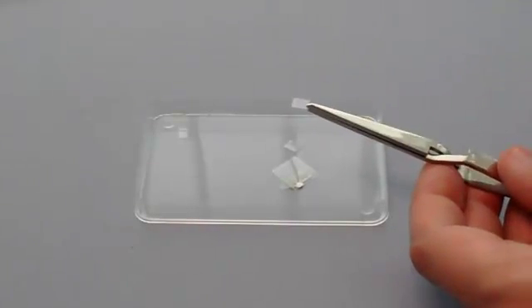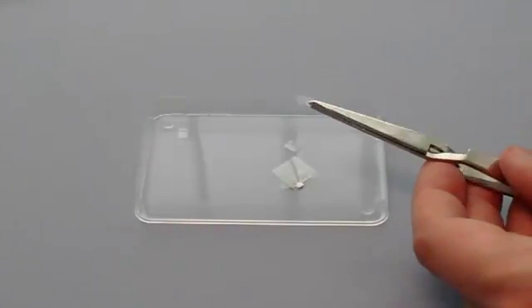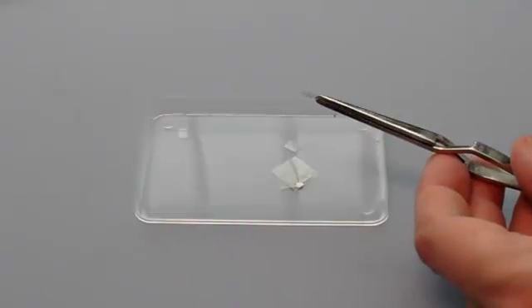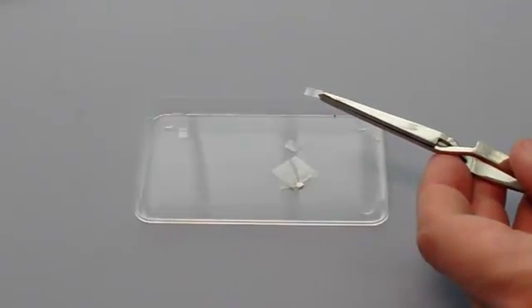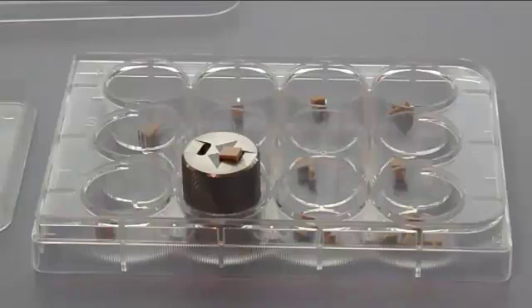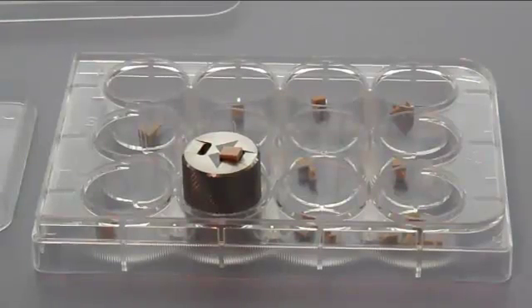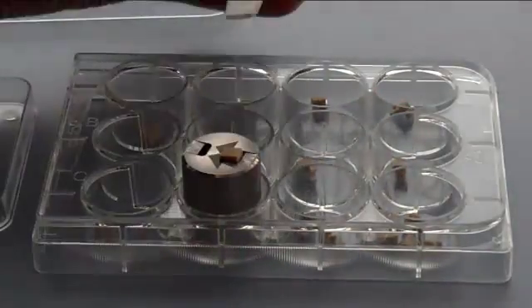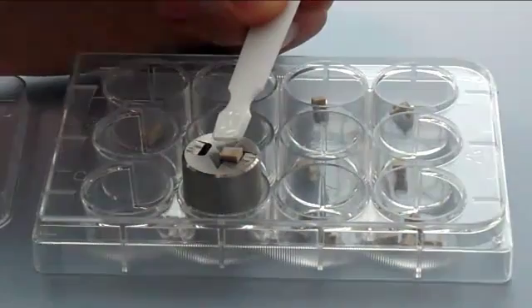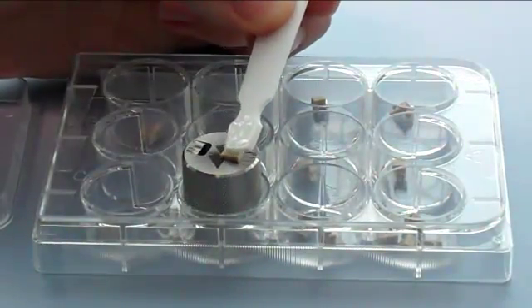The polymer film is cut into dimensions approximately 5mm long by 4mm wide. The film is less than 1mm thick, but the sample could be up to 1.5mm thick.